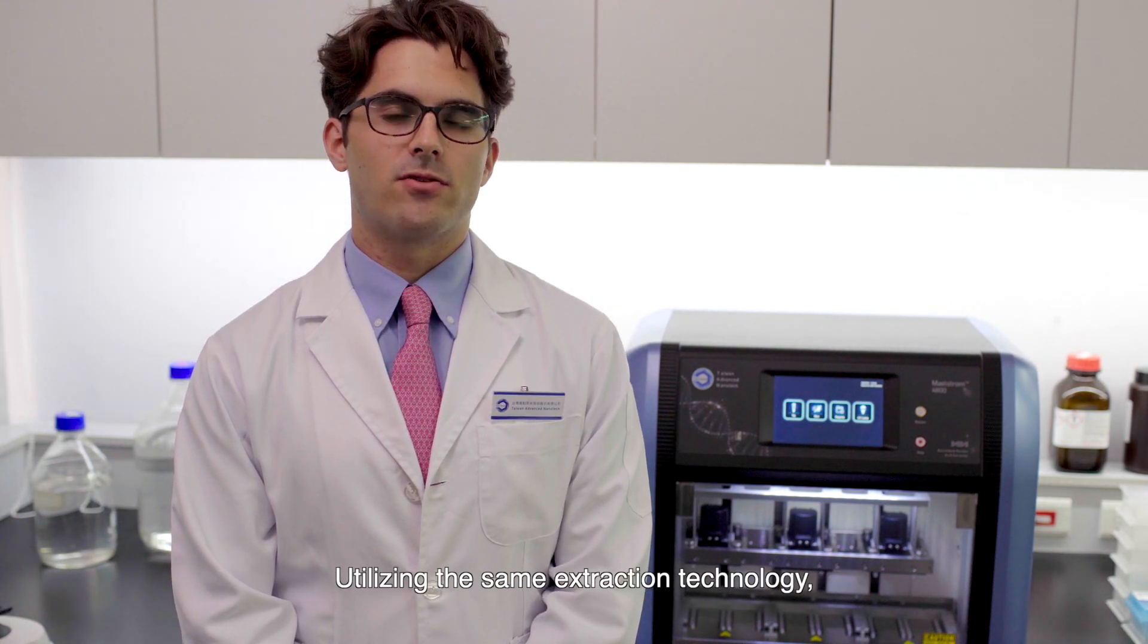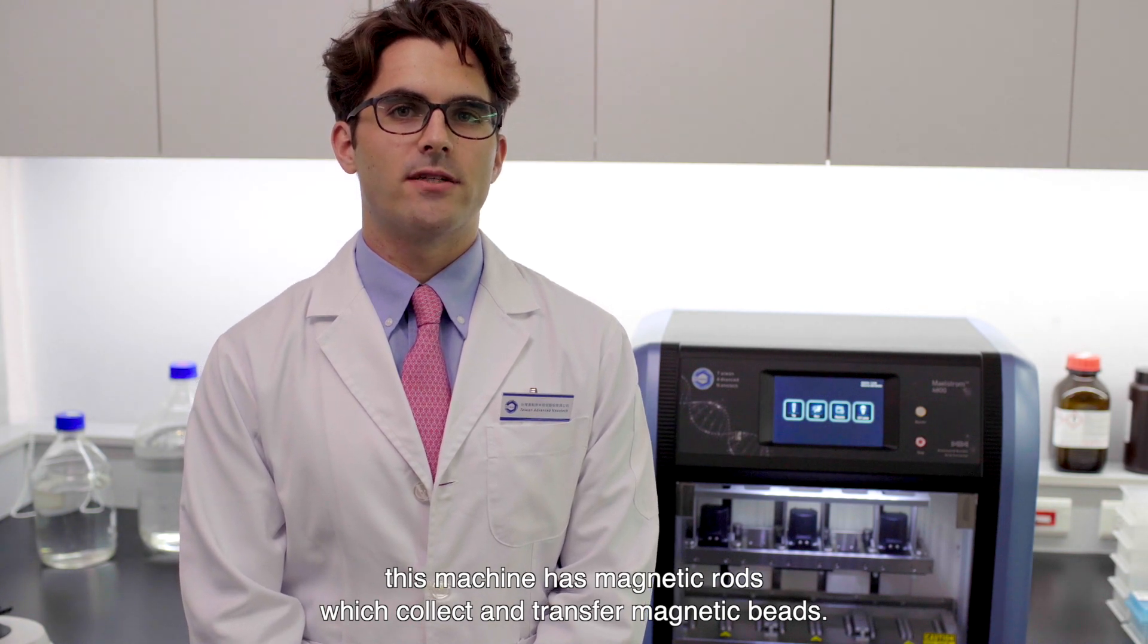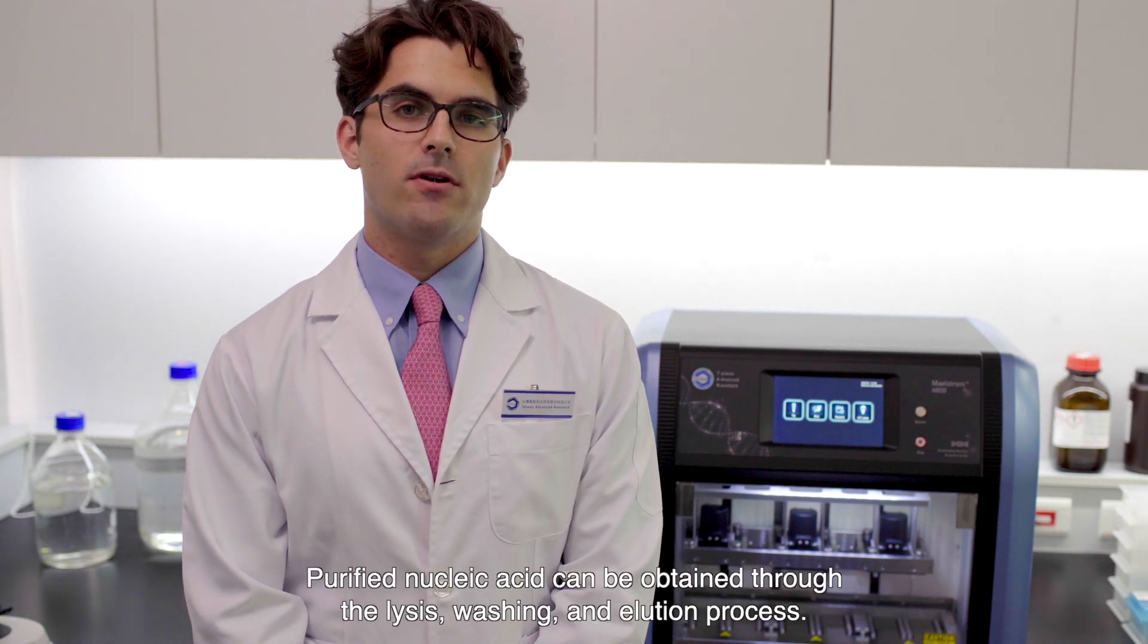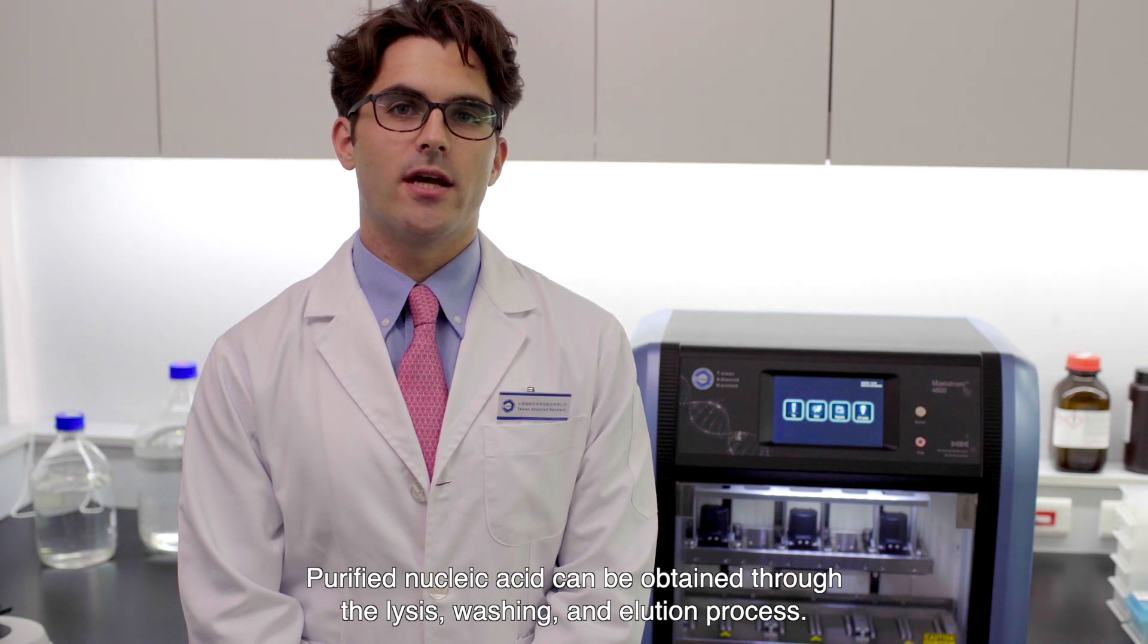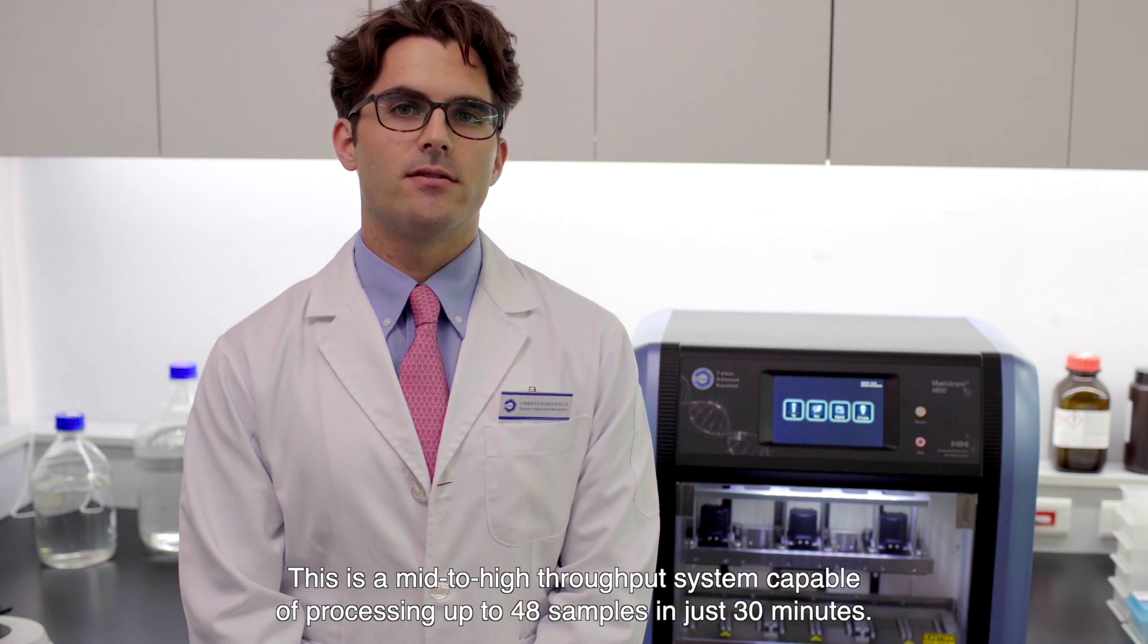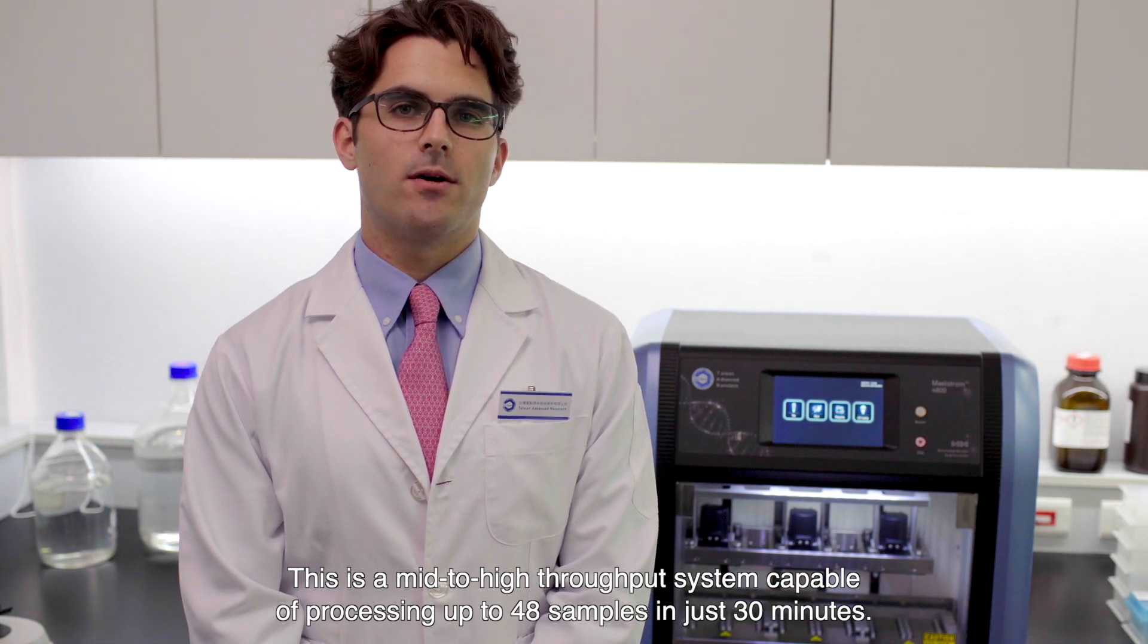Utilizing the same extraction technology, this machine has magnetic rods which collect and transfer magnetic beads. Purified nucleic acid can be obtained through the lysis, washing and elution process. This is a mid to high throughput system capable of processing up to 48 samples in just 30 minutes.